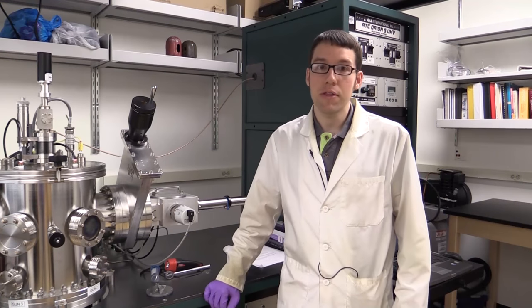Hi, my name is Mark Miller and I'm a graduate student in Professor Jun Lan Wong's Nanomechanics Lab at the University of Washington in Seattle. Today I'd like to demonstrate magnetron sputtering, which is a technique used for depositing thin films.